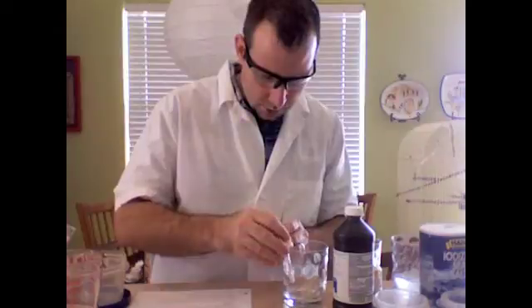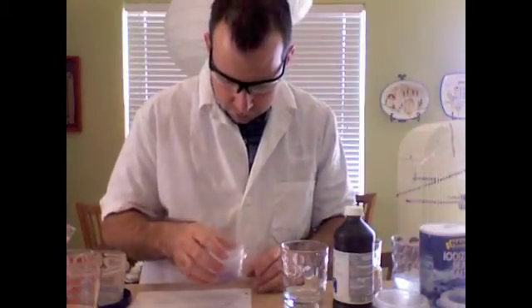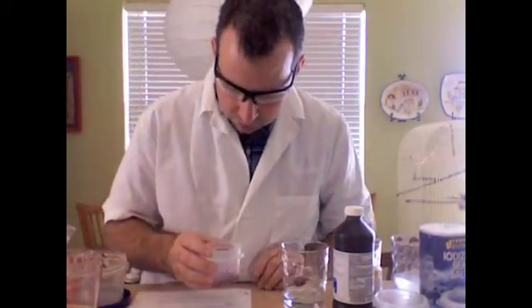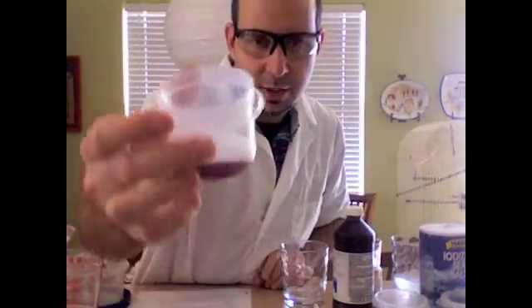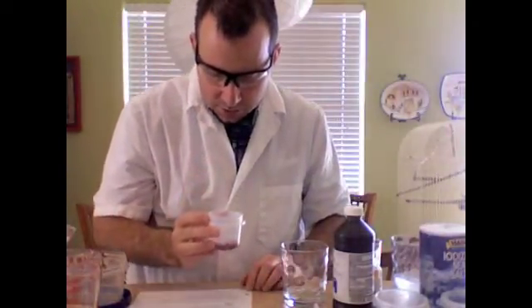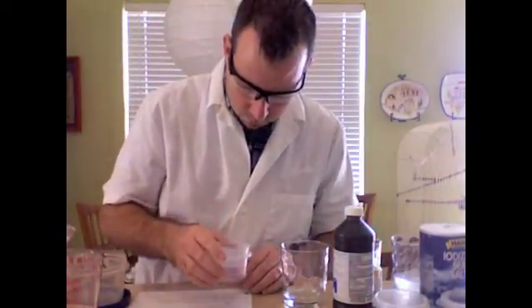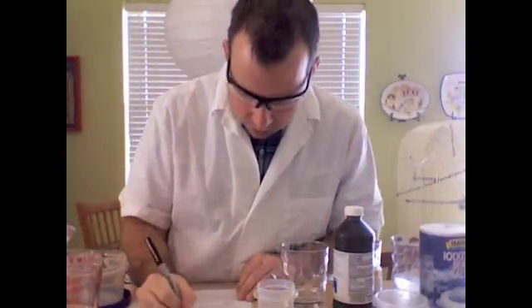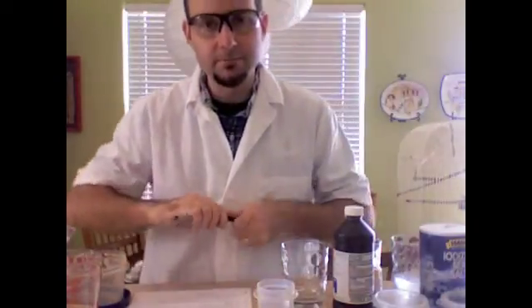So I'm going to take that, I'm going to swirl it around, and I'm seeing a lighter color. It's also forming some bubbles, so there's definitely a chemical reaction. It's a little lighter, maybe somewhat on the purpley pink side. So I might go ahead and put purple pink here. Okay?